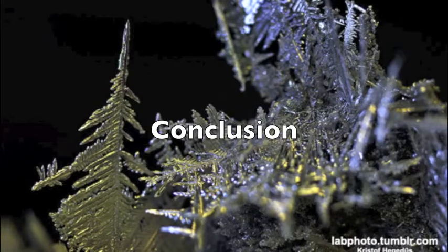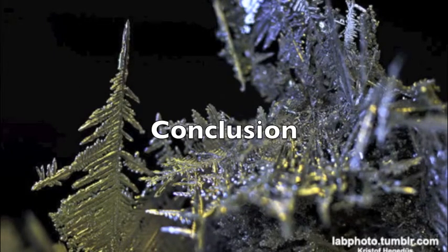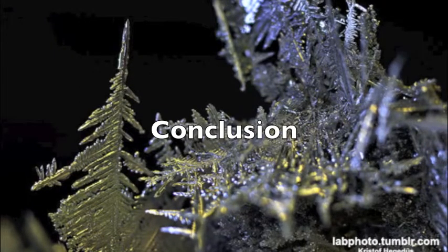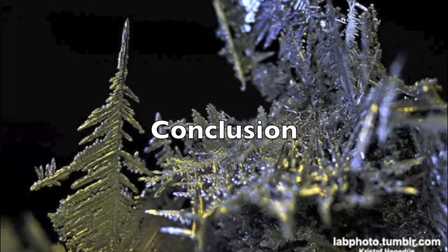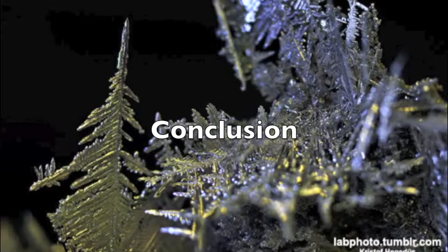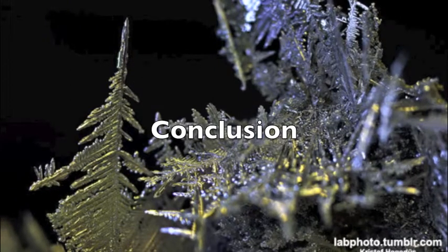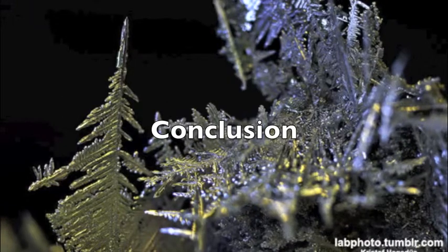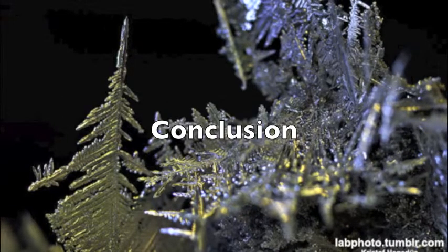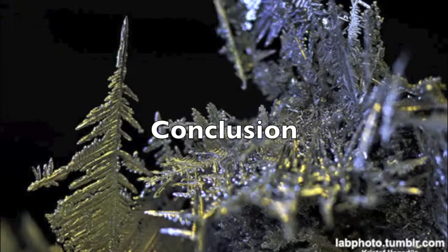This intriguing investigation involved a single replacement reaction with copper metal and silver nitrate, which produced silver metal and copper nitrate. During the first day of the investigation, the masses of copper wire and the 250 milliliter beaker were measured on a digital scale. After the measurements of the masses were recorded, the copper wire was wrapped around a pencil to create a coiled shape, and it was placed in a test tube.